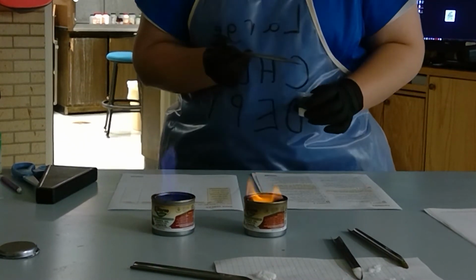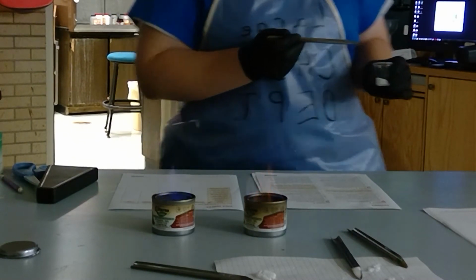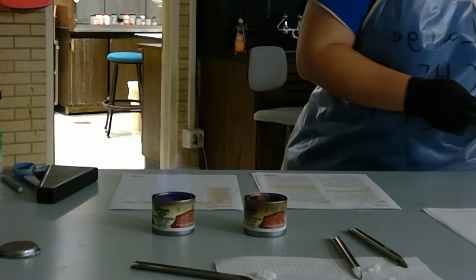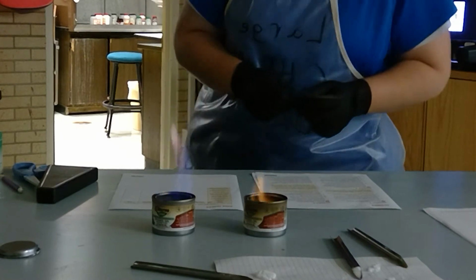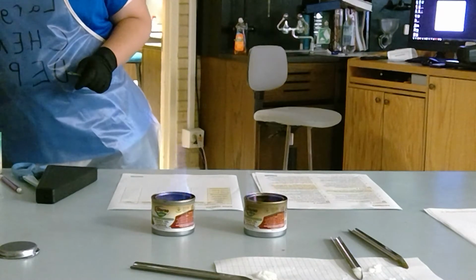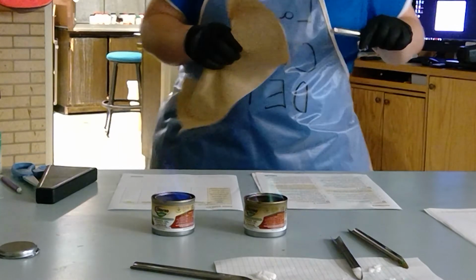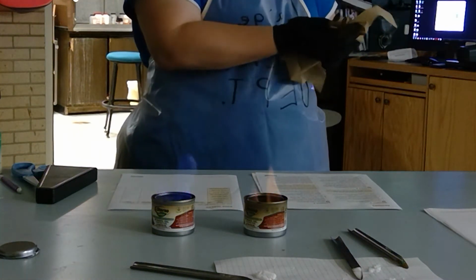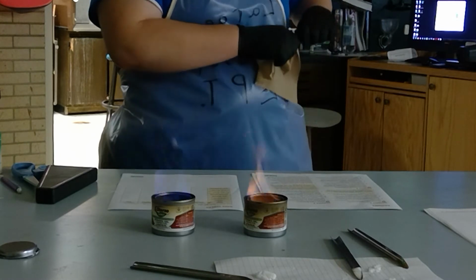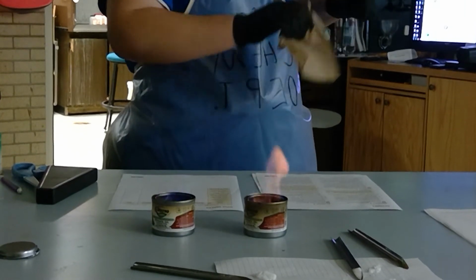So you've got four flame colors that you have to identify. You've seen those 4 colors, and those 4 colors correspond to one of those compounds on data table 3. I think my best choice now is to go with that one that's still burning purple. It looks blue.